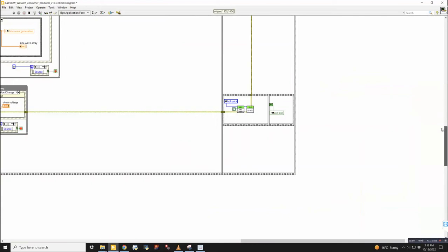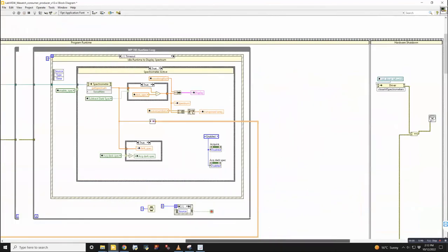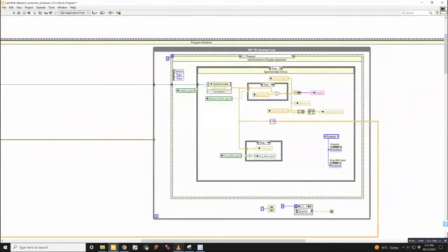So that's basically it about the overall flow of turning on the program, waiting for user input, and then shutting everything down properly. Are there any questions about just that before I actually get into the details of the way that the program responds to user input?